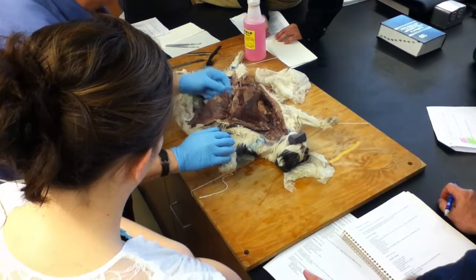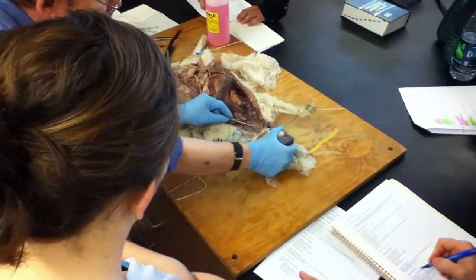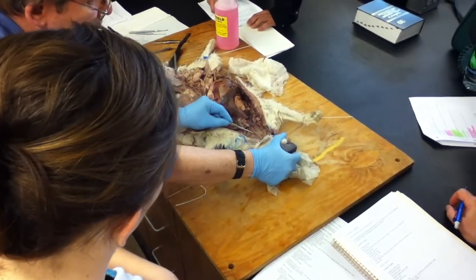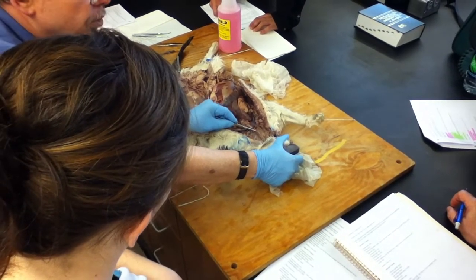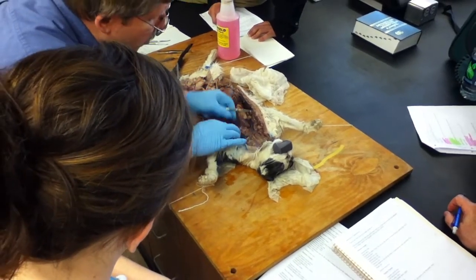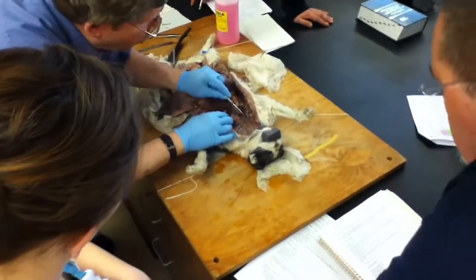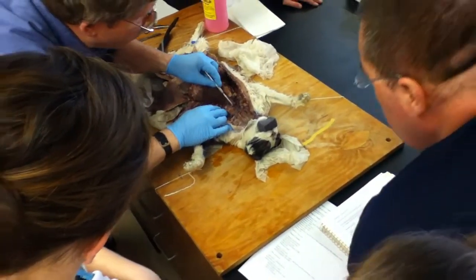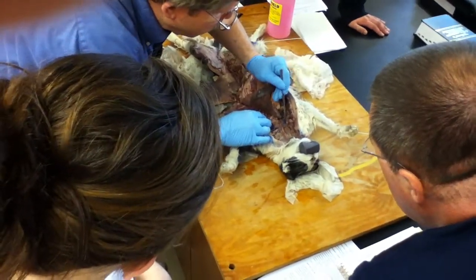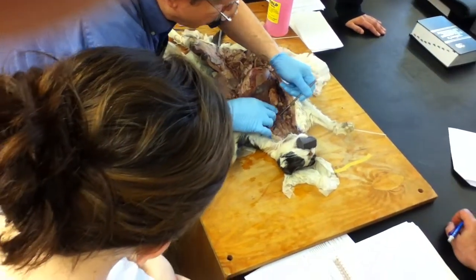Okay. So basically, did you see that? So what we're looking at, Thomas, is here on this side, then this one's cut. It's not the way they come. This one's intact, but basically you have carotid artery, and there's the vagus nerve. Okay. And so as they come together and come back farther down, see if I can move this out of the way, basically you'll see another major artery that gives rise to these guys. See if I can get under him from this side. This time. Here he is right here. See if I can, oh, it's starting to tear. I know.